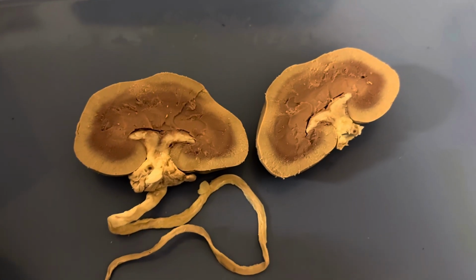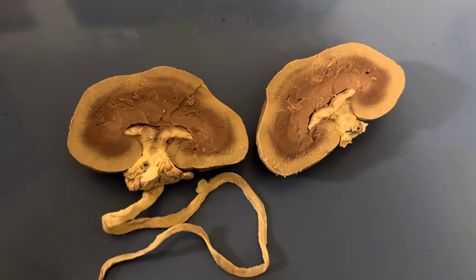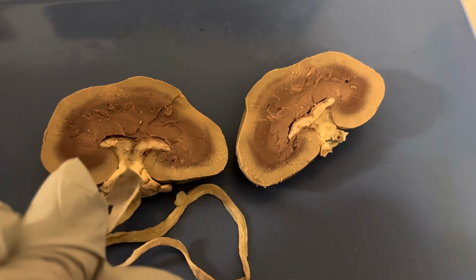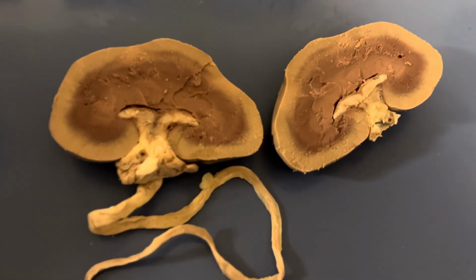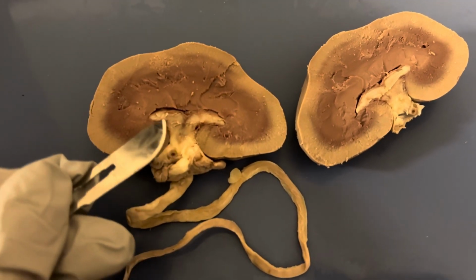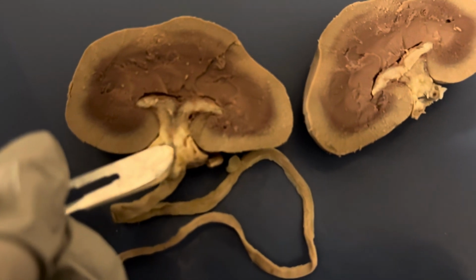And then I'm sure you're wondering what this section is here. This is filled with adipose tissue, but it is called the renal pelvis. And this is where that urine comes from, and it connects to the ureter of the kidney as well. So there's branches, and it's hard to see with this lighting, but there's branches within the renal pelvis, and these branches are called the calyx. And they're just small branches.